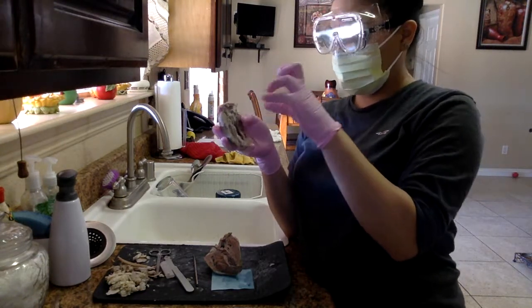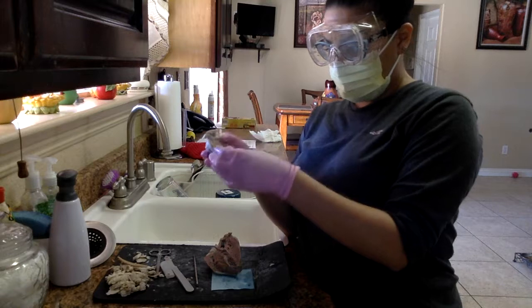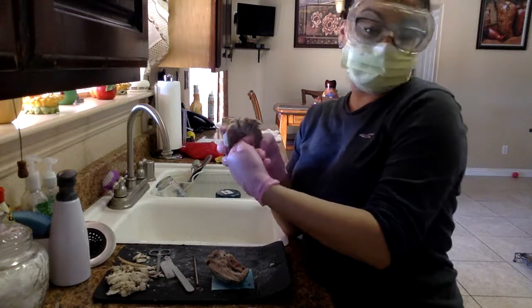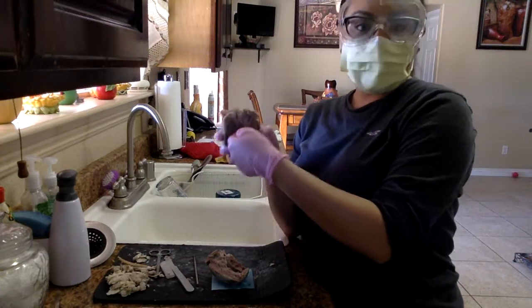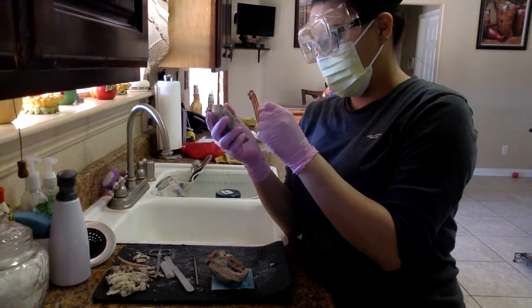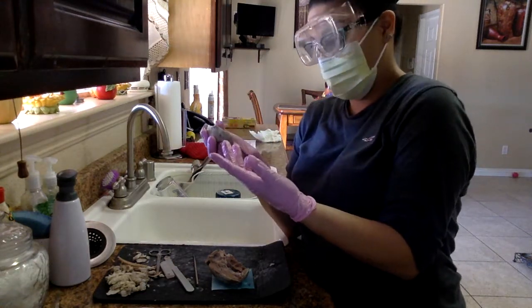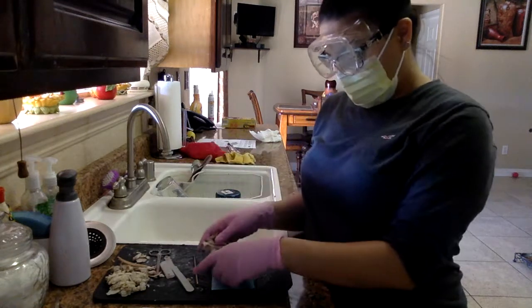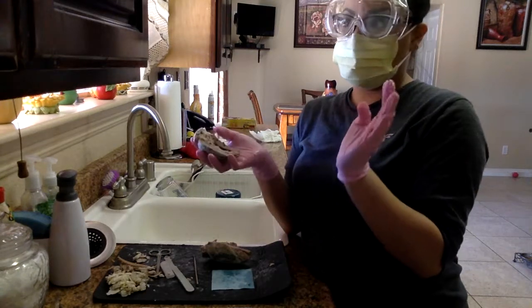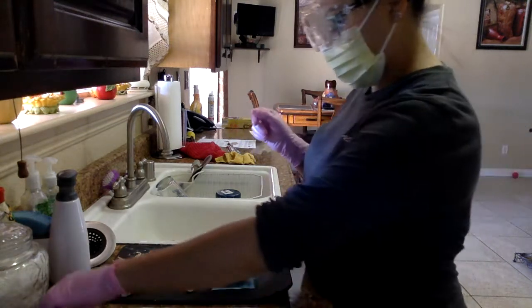We have a lot of little things I describe as strands of hair. It looks like guitar strings too. You can relate that to guitar strings as well. And these are called chordae tendineae. Just by the name, I can take a guess, it's probably tendons. So that's that. And then the tricuspid valve. I don't know if we said that. We did say the bicuspid valve. The bicuspid and the tricuspid valve.